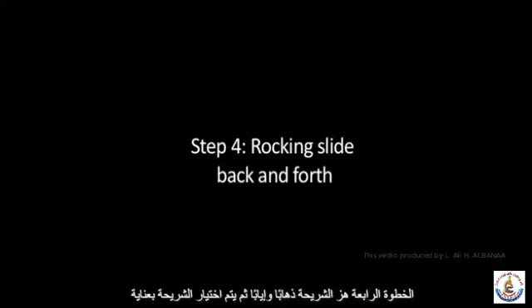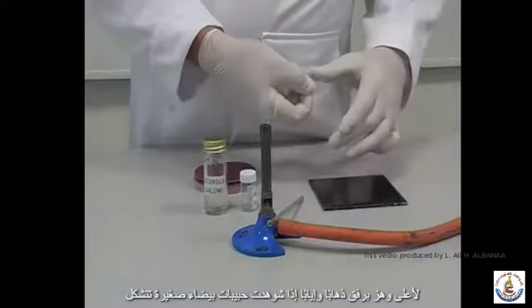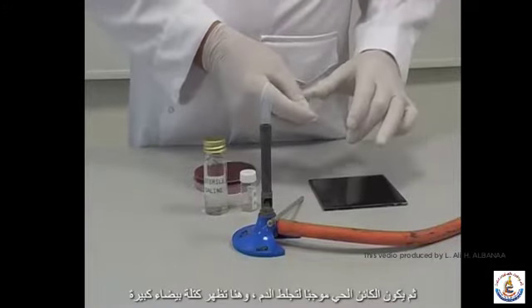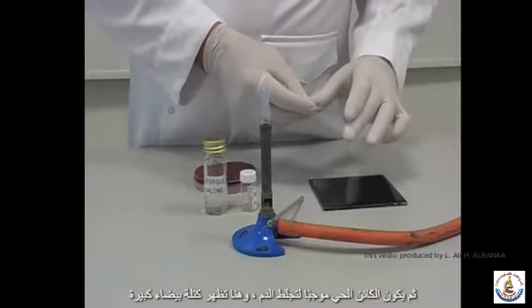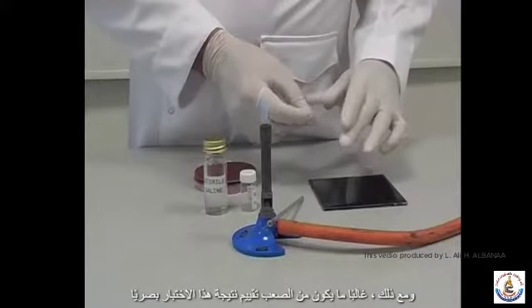Step 4. Rocking the slide back and forth. The slide is then carefully picked up and gently rocked back and forth. If tiny white granules are seen to form, then the organism is coagulase positive. Here, a large white clump is visible. Thus, this organism is coagulase positive. However, the result of this test is often hard to visually assess.